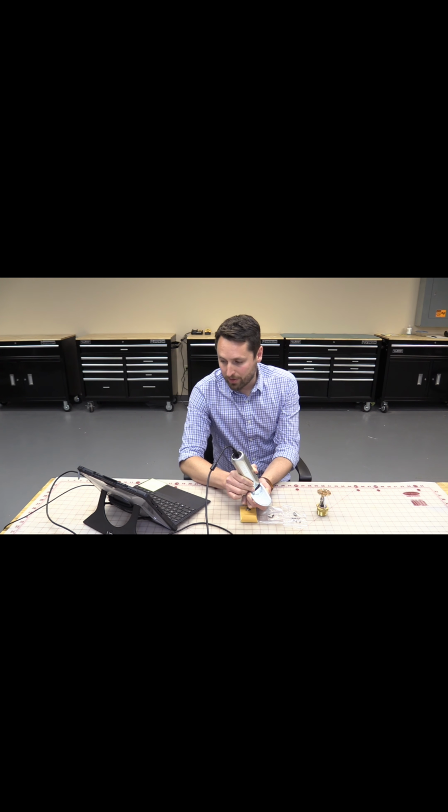So this to us is evidence that this crack has been spreading for a while. This wasn't a one-time event. Instead, we had a crack that had been forming, propagating through the wall, and then eventually, once it reached what's known as its critical crack length, brittly failed. All in one point from there, it fractured outward and caused our water loss and our damage.